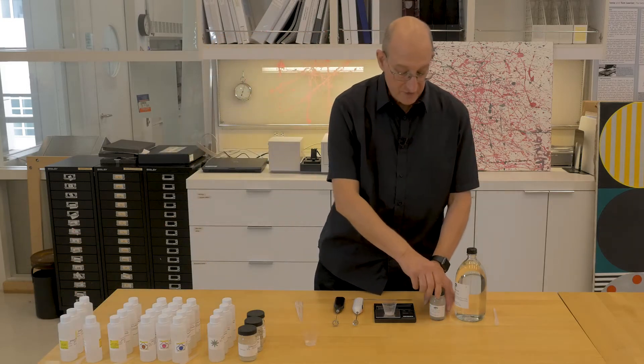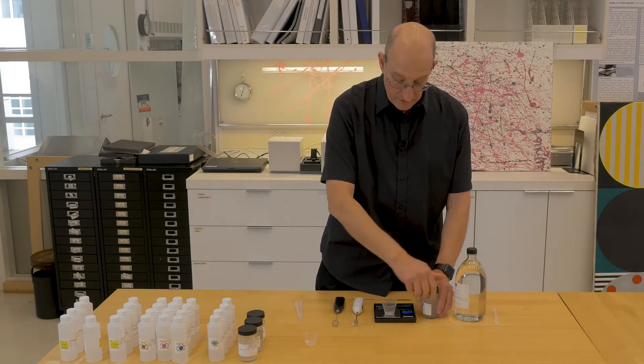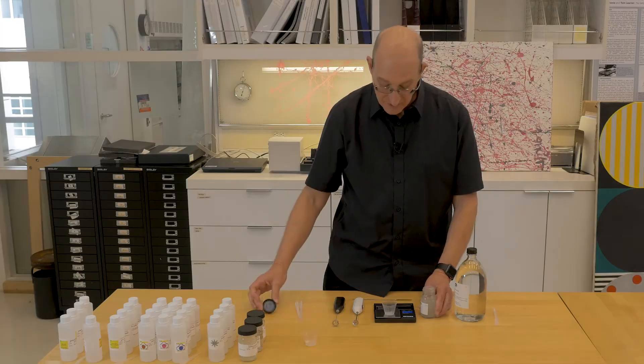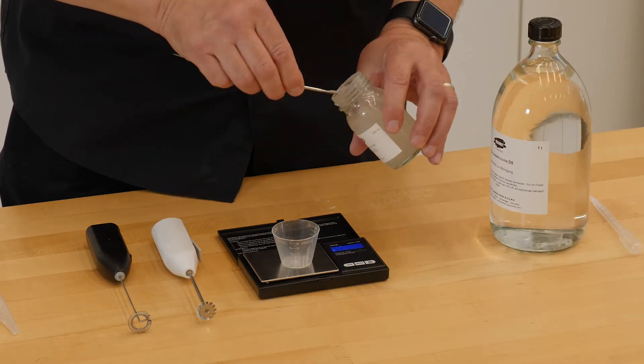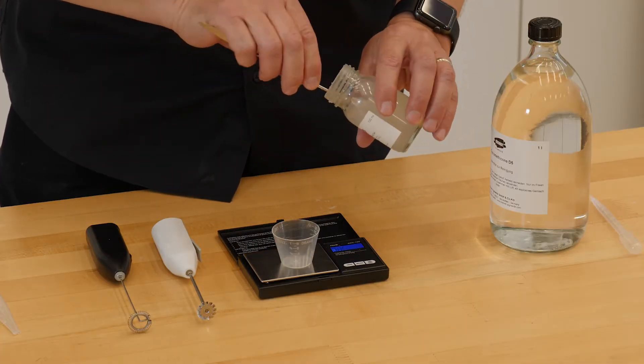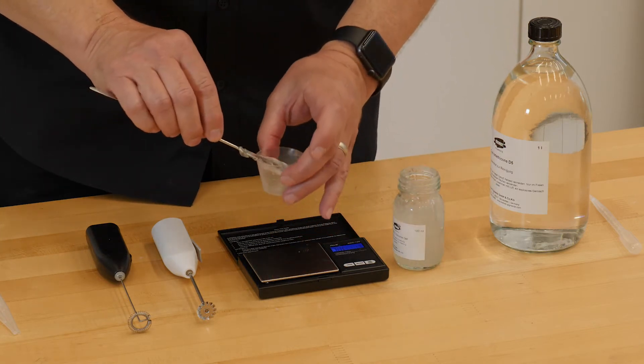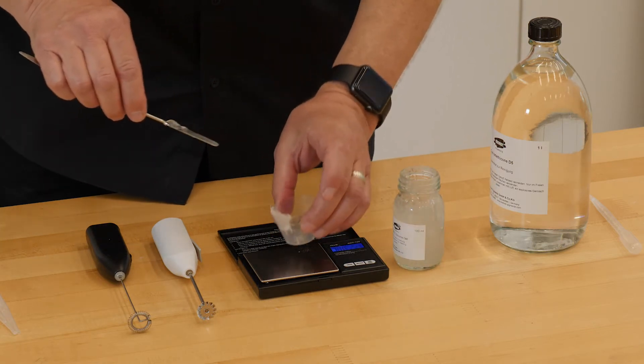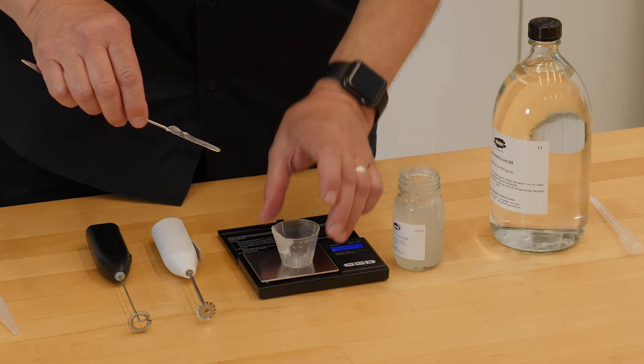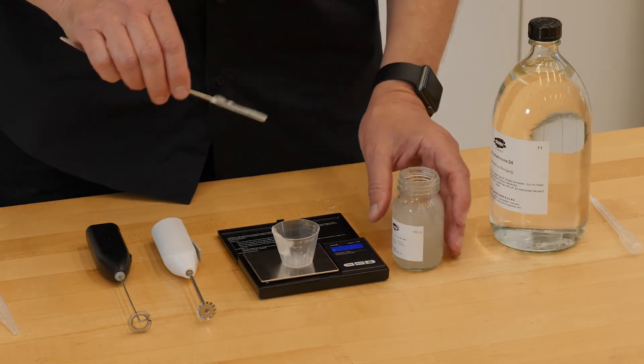Next we make up the KSG. We'll start with 2 grams of the KSG350Z, which consists of a silicone backbone with the ethoxylate groups bridging the silicone backbones, giving it the water-compatible ability to make the emulsion.